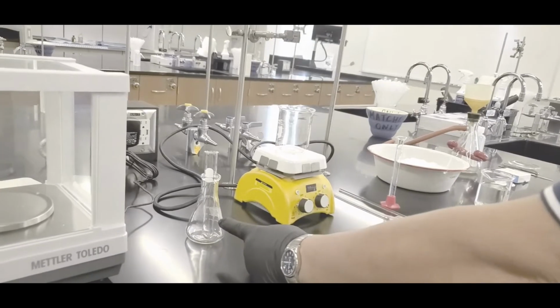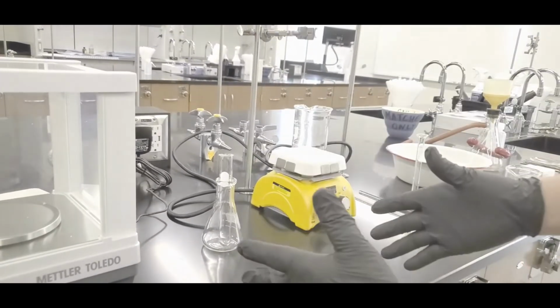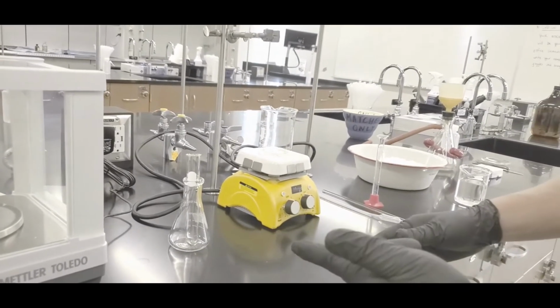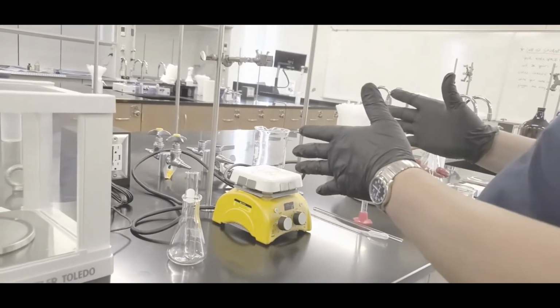Now, the container could be anything. The only purpose is for setting up the test tube. Okay, this is for getting the salicylic acid plus the acetic anhydride plus the phosphoric acid. Okay, now the next part is this. I'll show you how to do this as we go along.